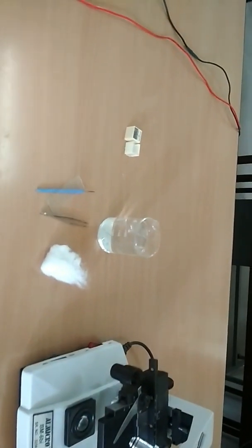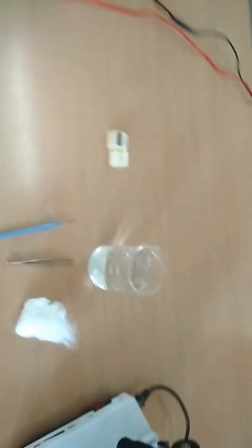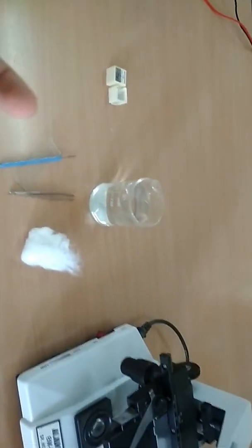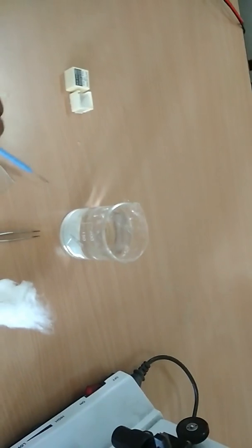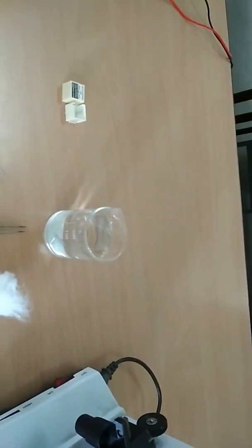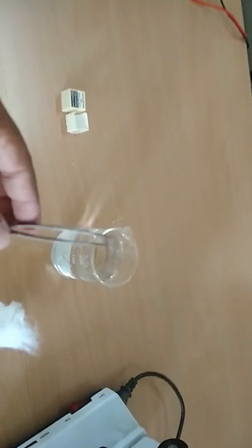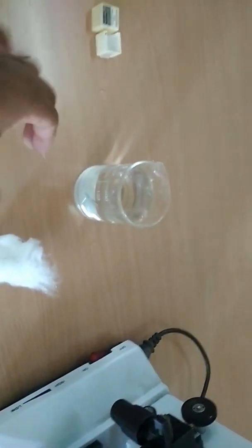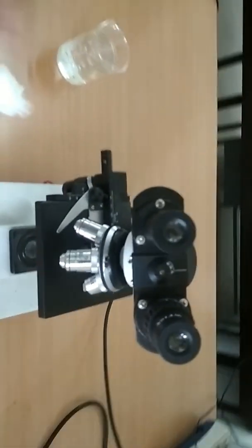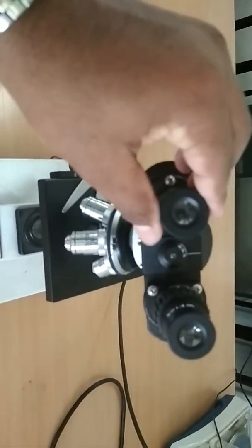Dissection required materials. Diseased leaf, needle, dissection needle, forceps, we can easily handle. Next, glass slide for microscopic observation. Cotton, water. This is your light binocular microscope.